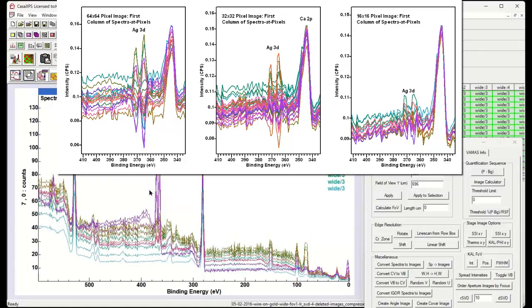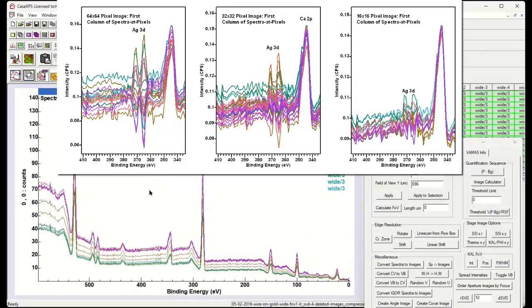but it's nowhere near the problem that we saw before. And that's because the PCA reproduction step is effectively forming a linear least squares solution based on the abstract factors. And since the abstract factors are now guided more by signal and less by noise, we stand a better chance of getting a good reproduction of the data, because we now have better signal to noise, the same abstract factors, and the least squares solution is more capable of reproducing the spectroscopic shapes.